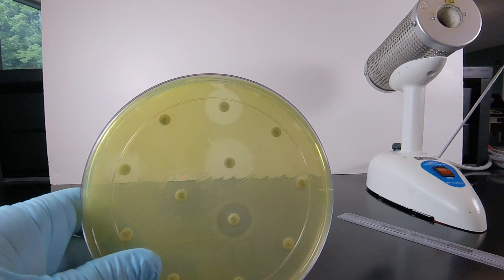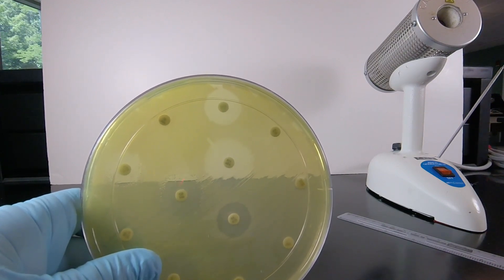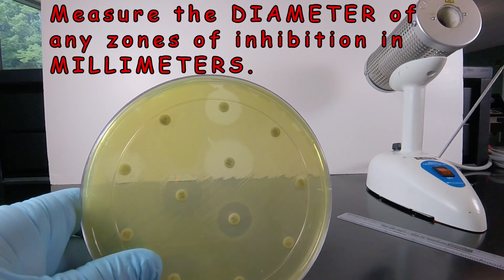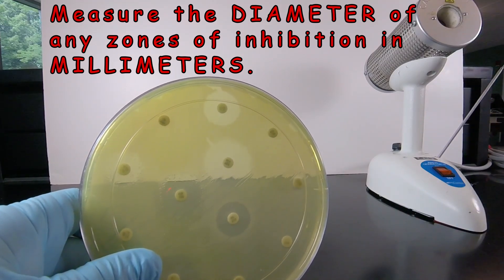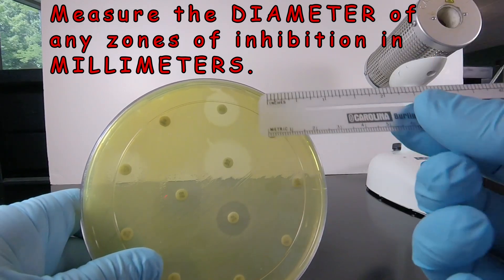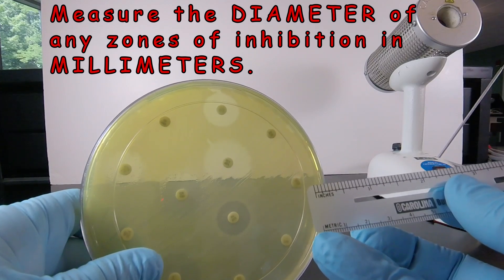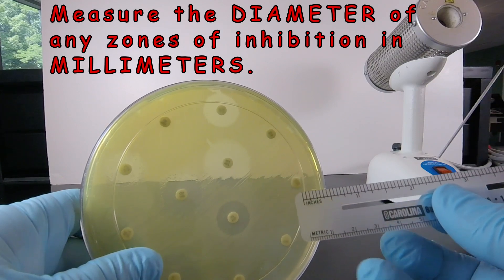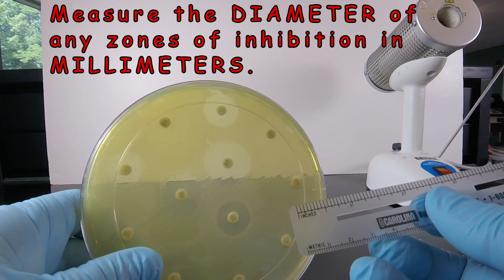To interpret the results of the Bauer-Kirby antibiotic susceptibility testing, we're going to be measuring the diameter of zones of inhibition in millimeters using a metric ruler. Make sure you have the metric side up, and remember that from 0 to 1 is 10 millimeters or 1 centimeter. We're measuring in millimeters, so each tiny little hash on the metric ruler is 1 millimeter.